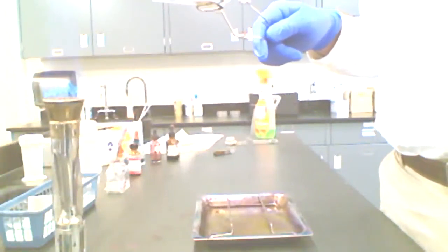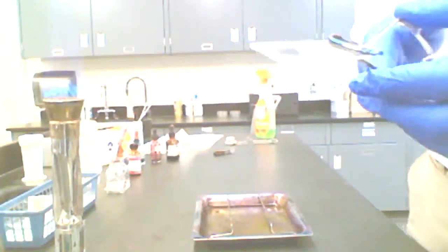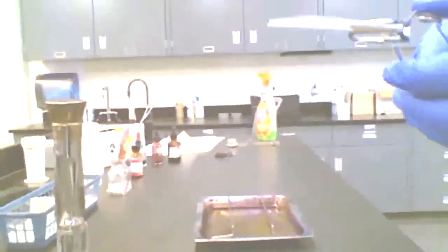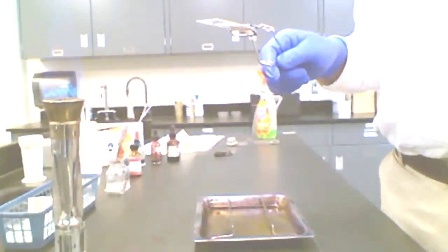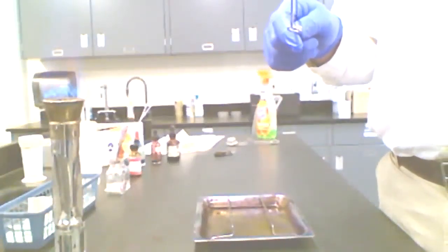Let's see if we can do this so that you can see it. But before I do that, let me show you the smear. If you can see that, see how what formerly was just clear glass has this sort of cloudy smear on it. That's actually a very thick smear, but like I say, for a beginner, that's perfectly okay. So I'm going to go ahead and heat fix.